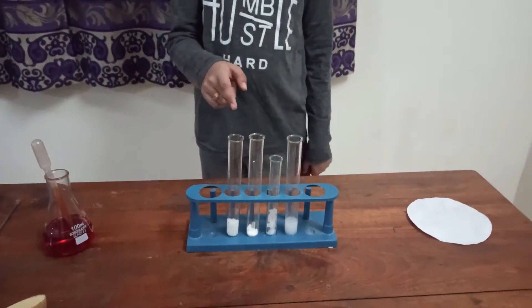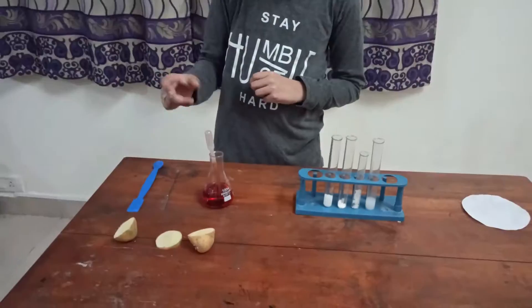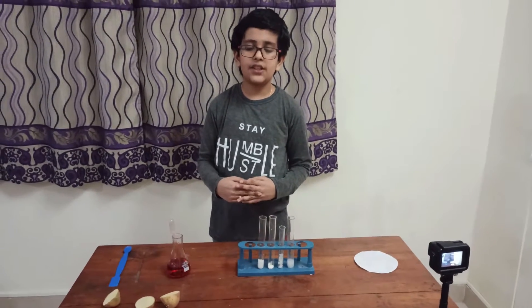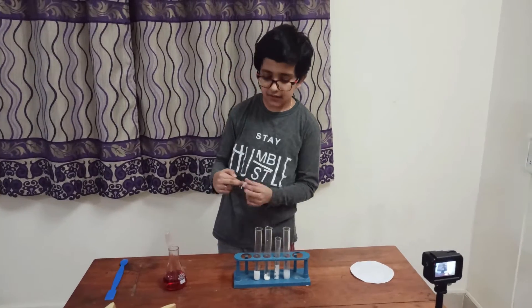Hello everybody. Today we are gonna do an experiment. In these four test tubes, there are four different reagents. Two of them contain starch, and today we will show how to determine if they have starch. This is some iodine solution. When it contacts something that has starch, it forms polyiodide chains which turn the starch a purple-black color.